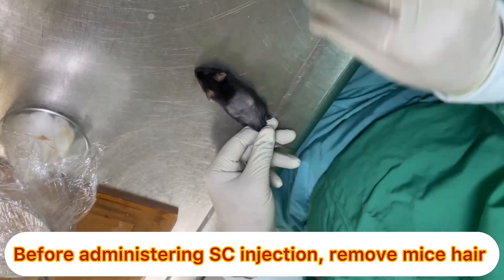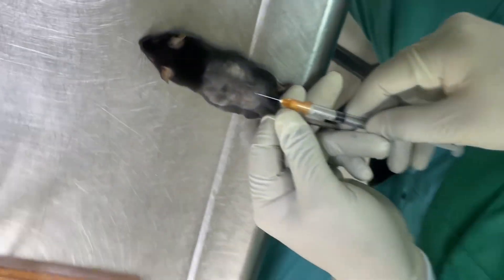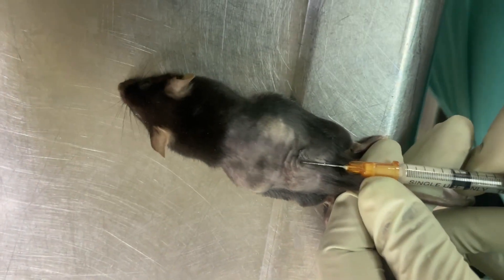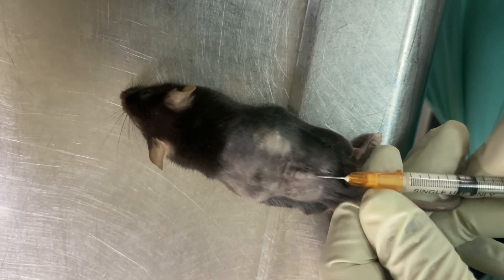For the SC injection, we shaved the mice skin and removed all the hair so that we can clearly see the cutaneous layer of the mice.